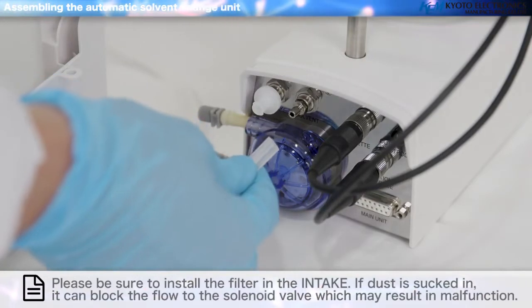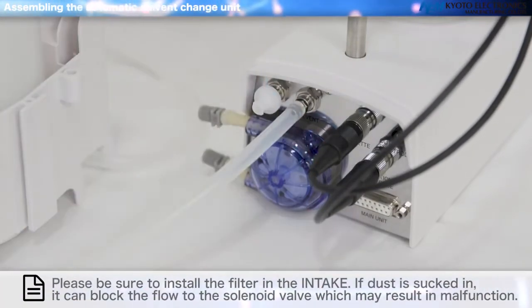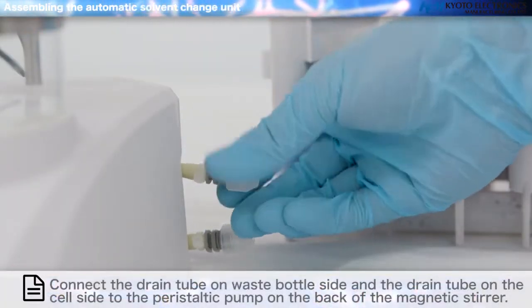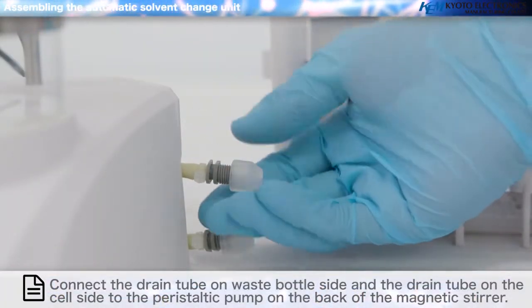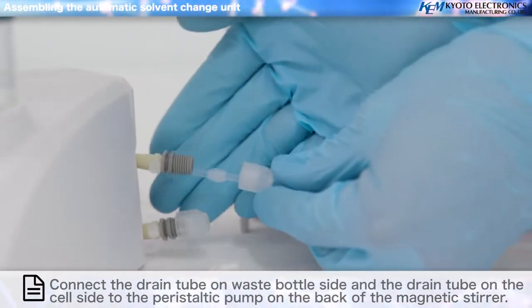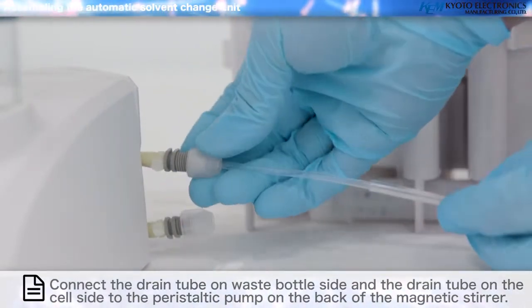Connect the connected silicone tube to solvent on the back of the magnetic stirrer. Connect the drain tube on the cell side and the injection tube to the plug for the cell. Connect the drain tube on waste bottle side and the drain tube on the cell side to the peristaltic pump on the back of the magnetic stirrer.